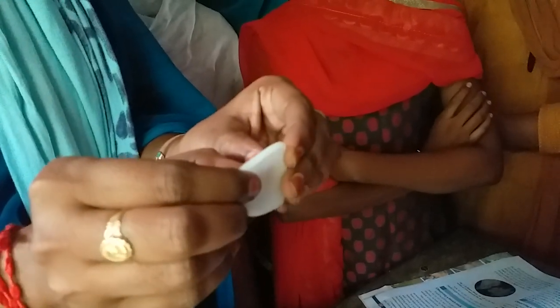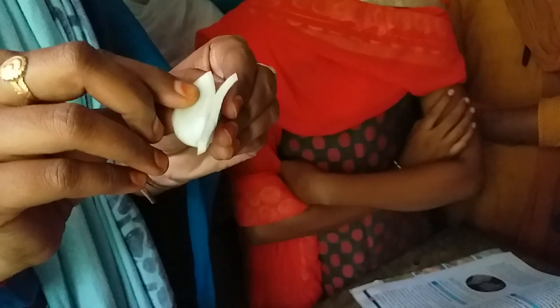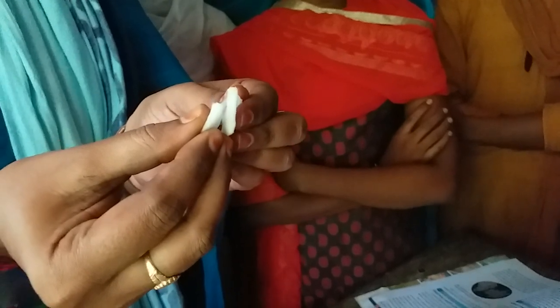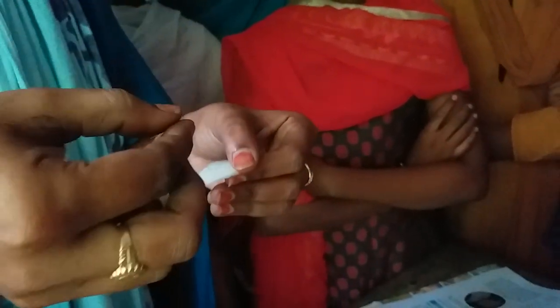Like this. Now we have to separate these two parts. Here what you have observed — a translucent thin membrane is appearing here. I am separating this translucent membrane and keeping it in water in a watch glass.